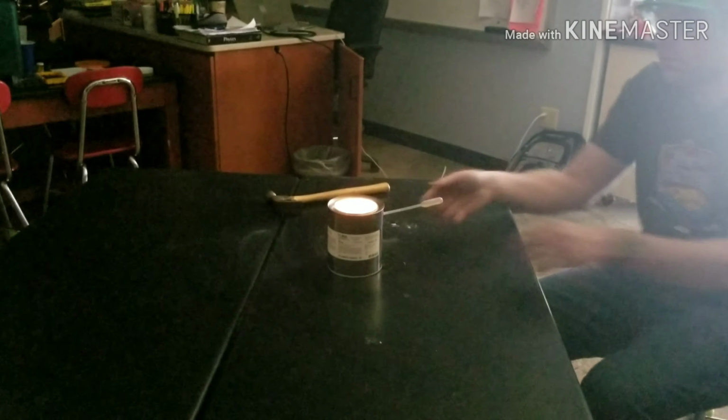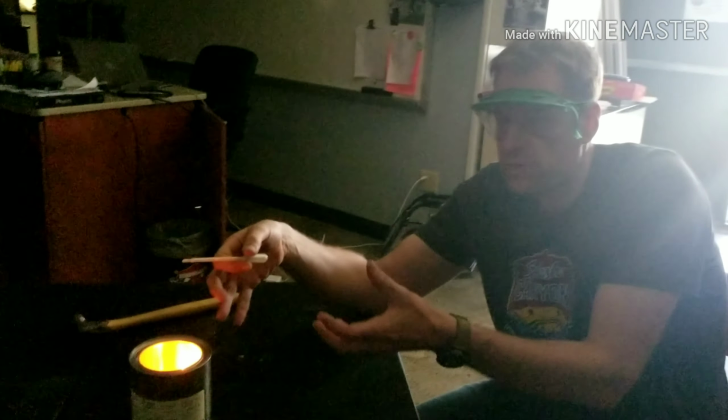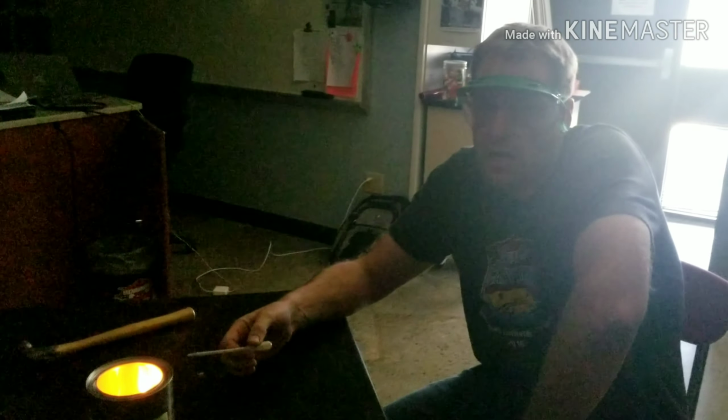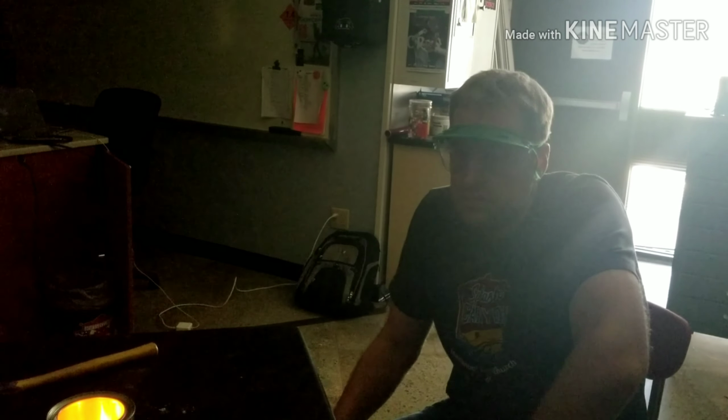All right, so we had a reaction, a very small amount of grain dust, about the size of a pea, but when I squeezed the pipette, it expanded to about the whole size of the inside of the container, so the surface area was increased by many, many times. And so that grain dust was then in contact with the oxygen molecules more often, and so the reaction would happen quickly.